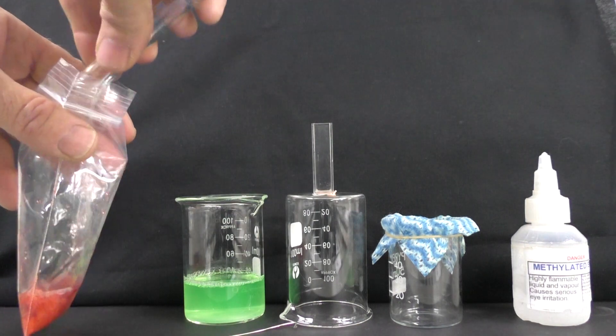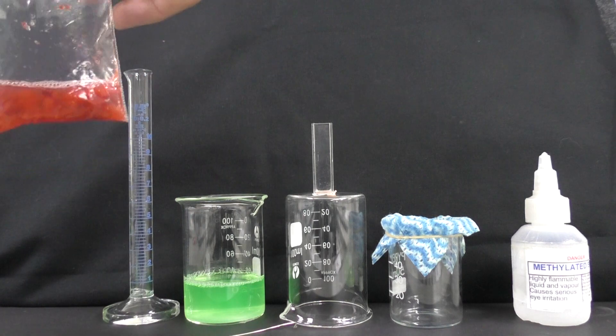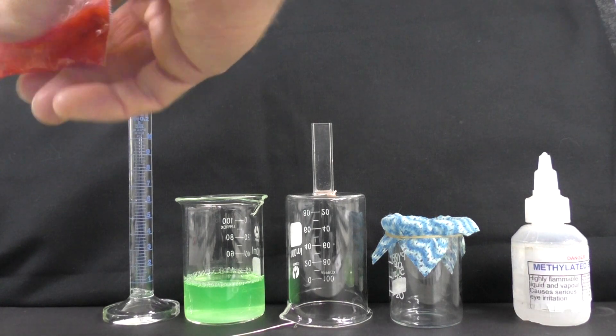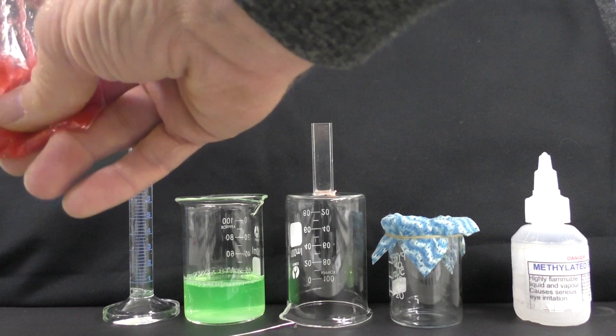So this is about 8ml. Actual volumes aren't all that critical here. We'll seal that up and give it a good mash. Mix it all up and we'll leave that and stir that for five minutes.